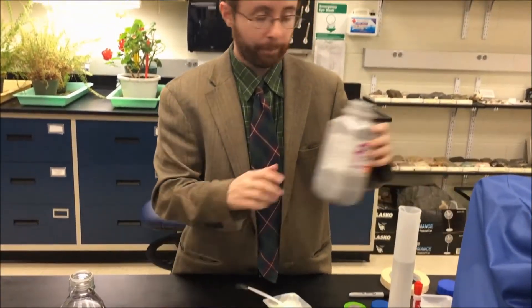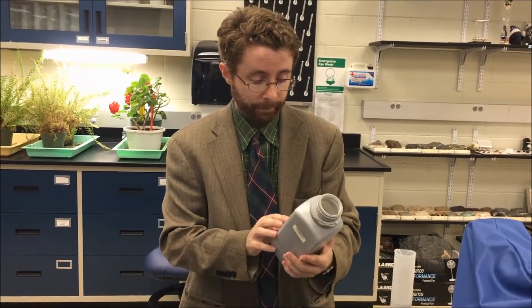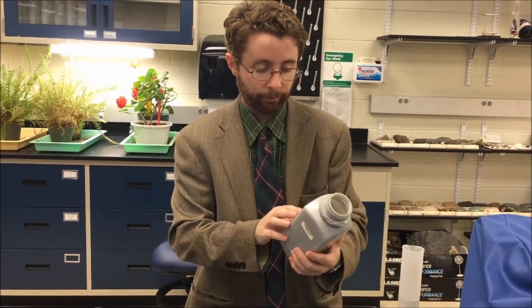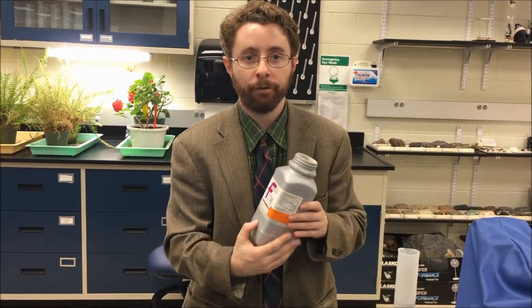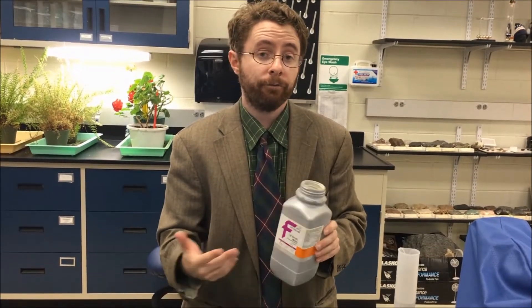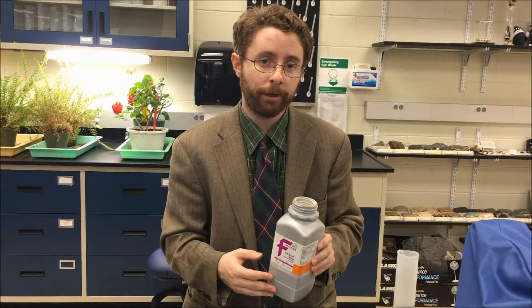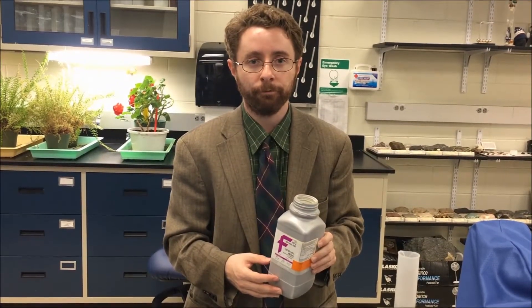Here I'm going to demonstrate how we prepare an LB agar plate. The first thing we need to do is take our LB powder — it's in a dehydrated form, so we simply have to add water. If I read the directions, it says to add 25 grams of this powder to 1 liter of water. I only want to prepare 200 mils in this demo, so instead of adding 25 grams to 1 liter, I'm going to add 5 grams to 200 mils of water.